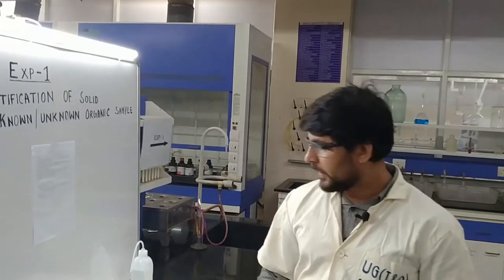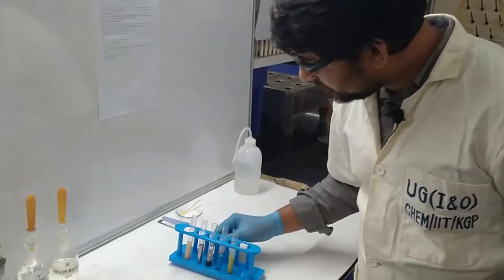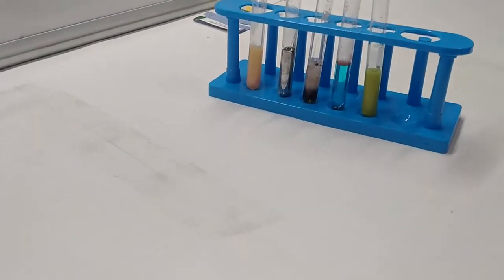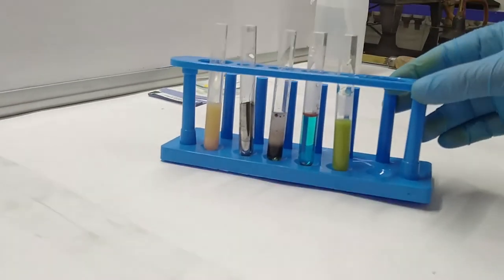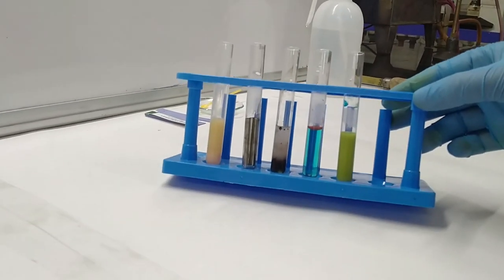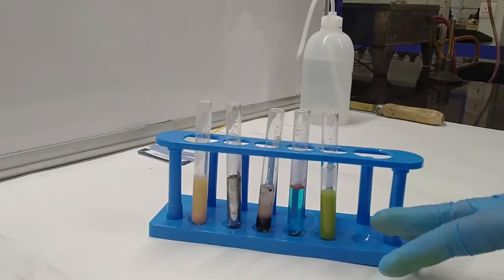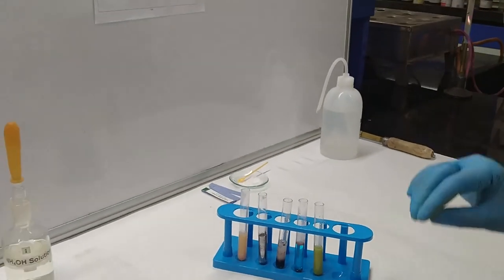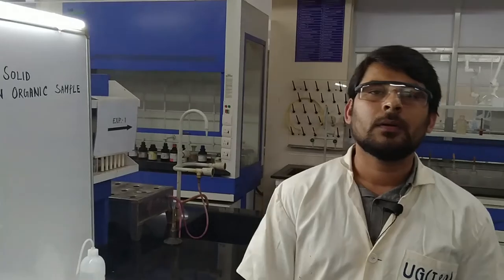That pure white precipitate has now converted into a salmon pink color. This is the actual observation of the lead acetate test for glucose, and it is positive. Our lead acetate test is completed. After doing all 5 confirmatory tests, we get all positive observations, and from this we can conclude our sample is glucose. Thank you guys.